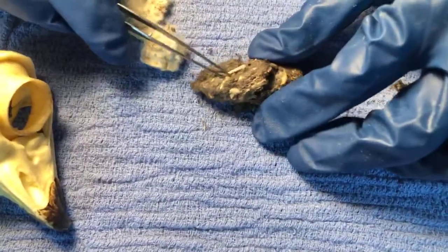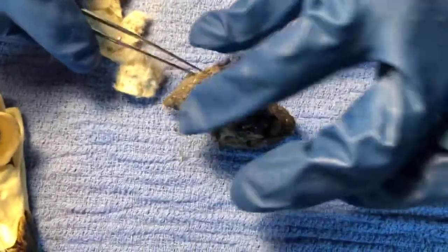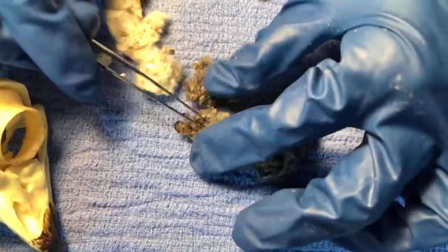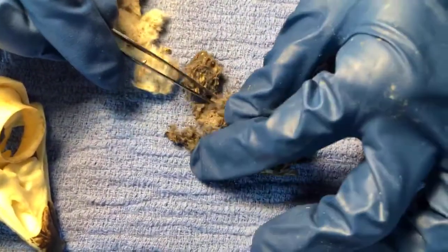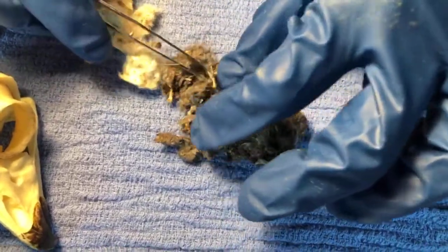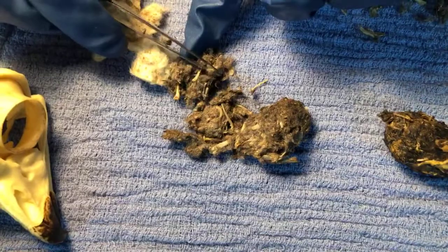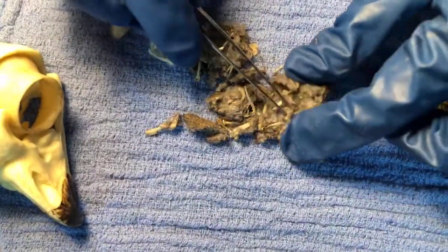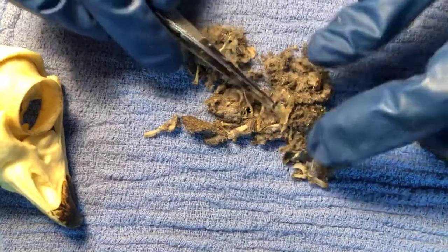And this one looked really promising because it had big bones on the outside. And this is our great horned again? This is our great horned again. Yes. And they do, of course, cough up their pellets in captivity, when they're in care in the wildlife hospital, as they do when they are wildlife ambassadors. See, that's a bigger one right there. So interesting.